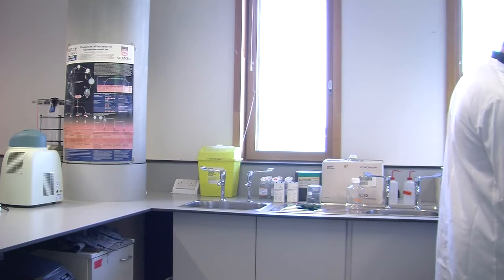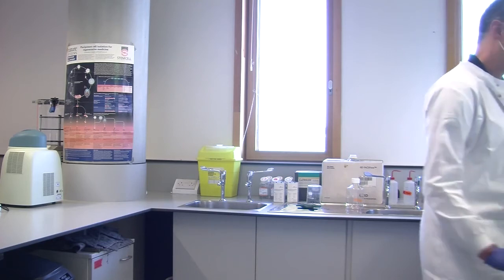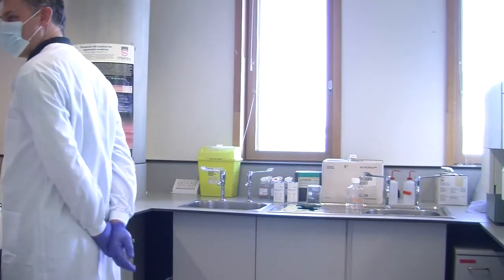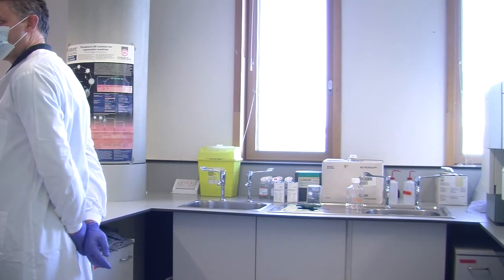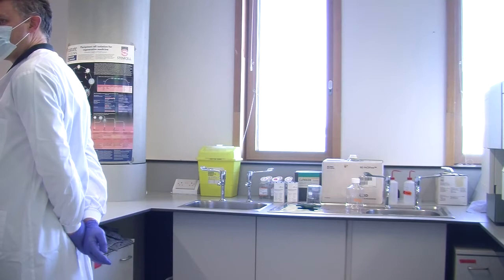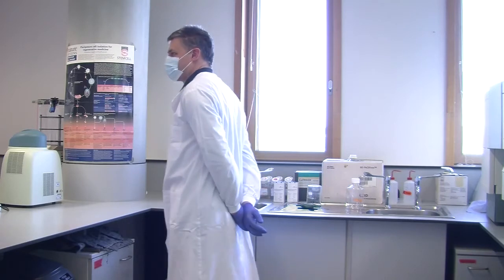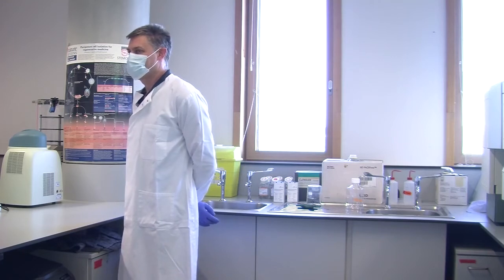So if you use the 1 milliliter pipette tip and set it up for 1 milliliter, after you are able to aspirate. Be careful: first, with the pipette outside, press to the first stop. Inside, gently release, because if you go inside and press, there will be bubbles going in and your cells will be disturbed, and after, when you remove the PBS, there will be cells going out. So, first outside, press it. Inside, release gently, and dispose.